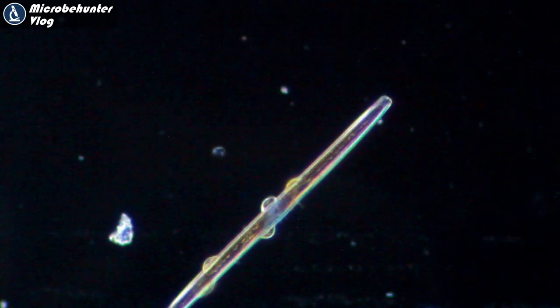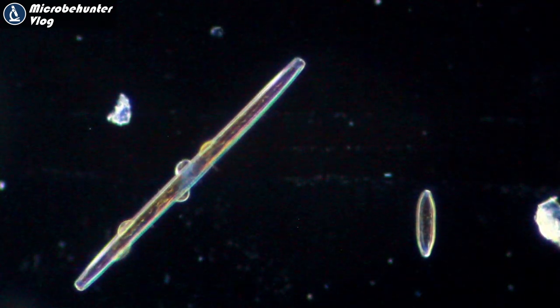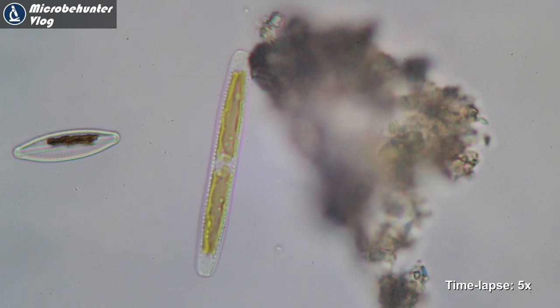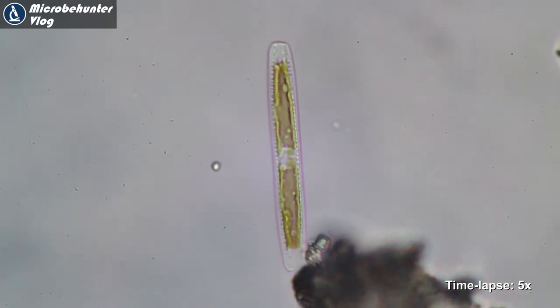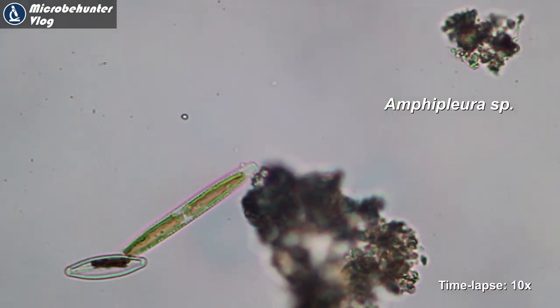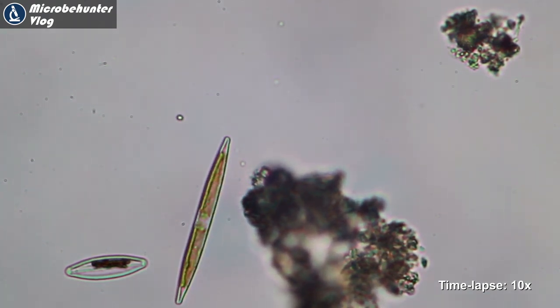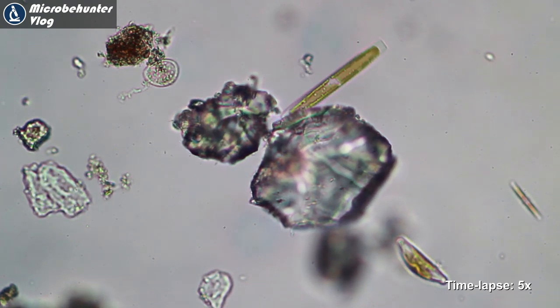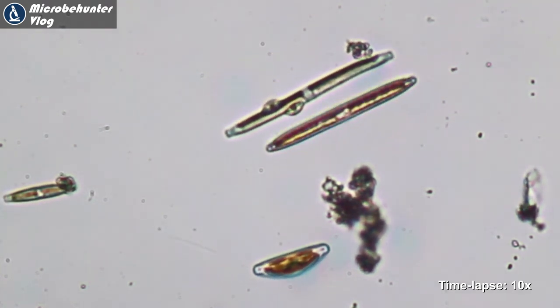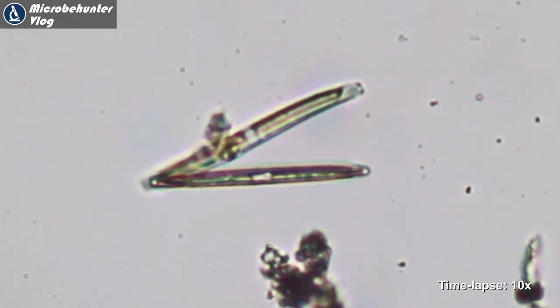Now in dark field mode, you get a slightly different impression as they glide along happily. So yes, winter microscopy is definitely something you can do. Here again in time lapse so you can see the motion a little better — going back and forth, perhaps needing a soil particle or solid surface to actually move along. Look at the one at top center: the diatom is stationary but the soil particle is moving back and forth. It's pretty fun actually.